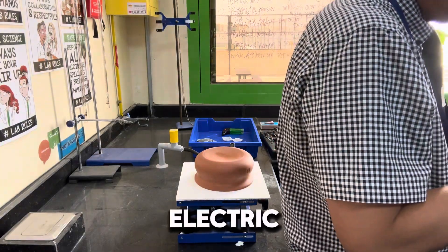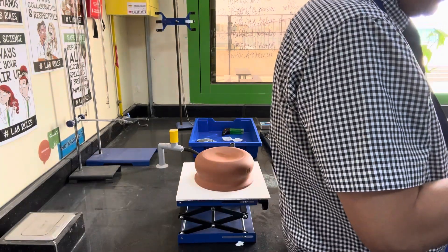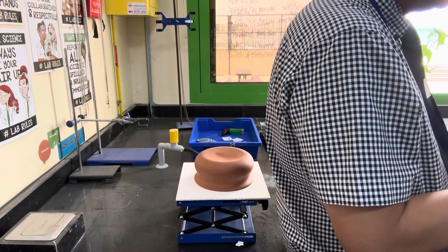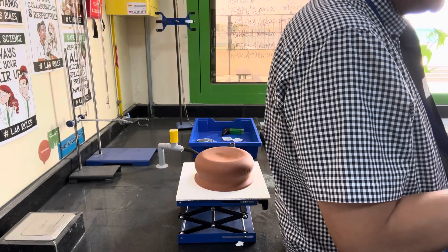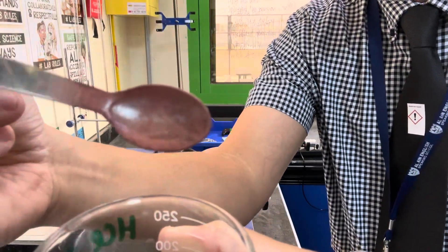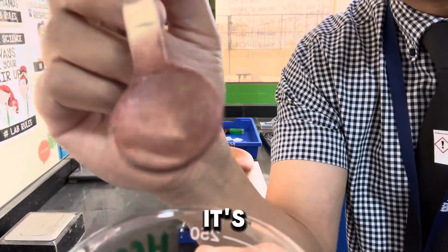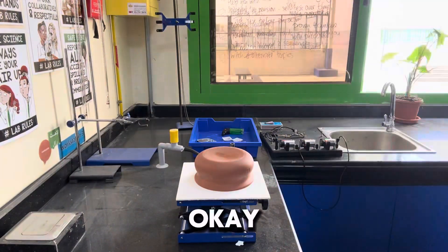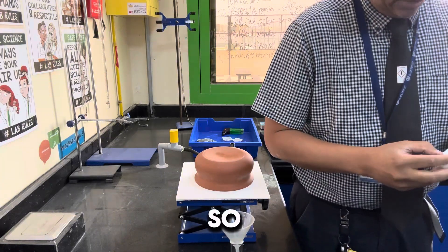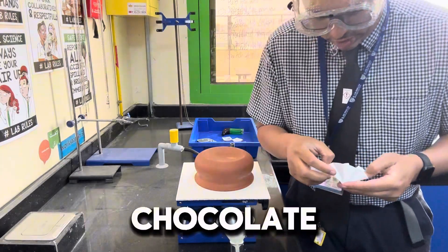I've got an electric personality, what can I say! Any unreacted zinc also reacts with the acid. I hope you can see that it's a red metal powder. Have a look at that — it looks like hot chocolate. Interesting. It's got a consistency of hot chocolate.